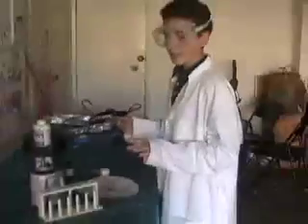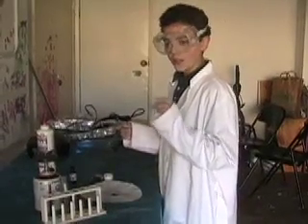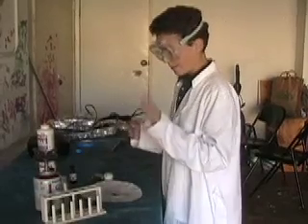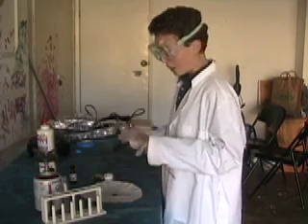The hydrochloric acid will react with most of the impurities on it. So hopefully you'll be able to see at least a little bit of the green tint that the boron gives the flame. I'm going to close the garage door so it's nice and dark.